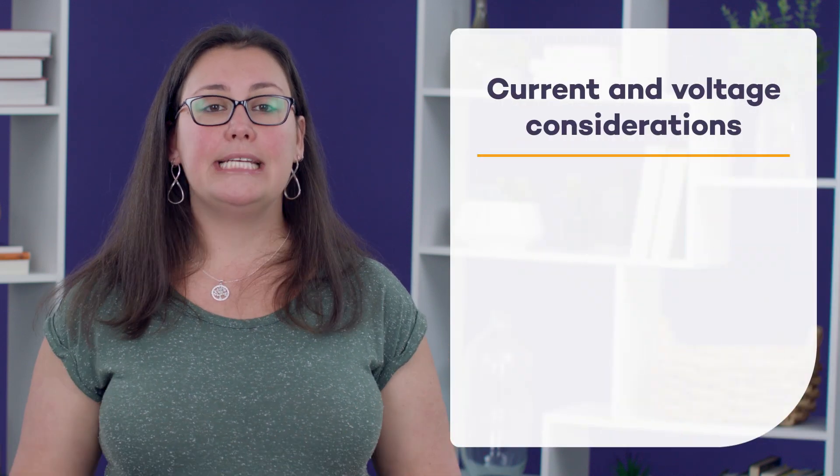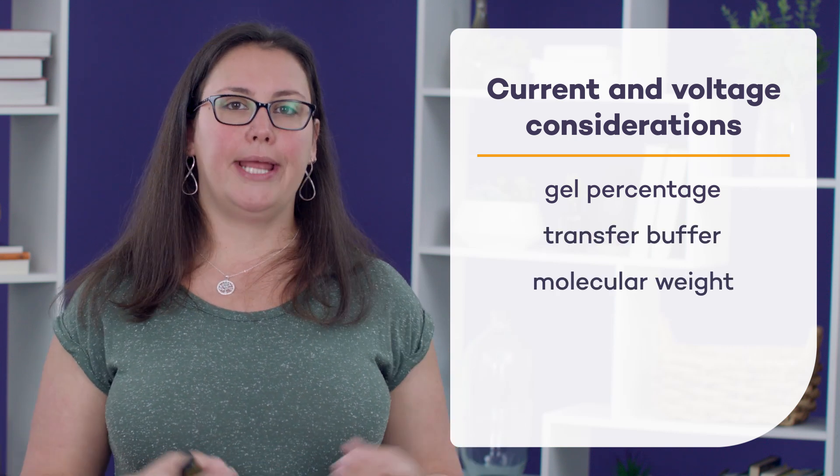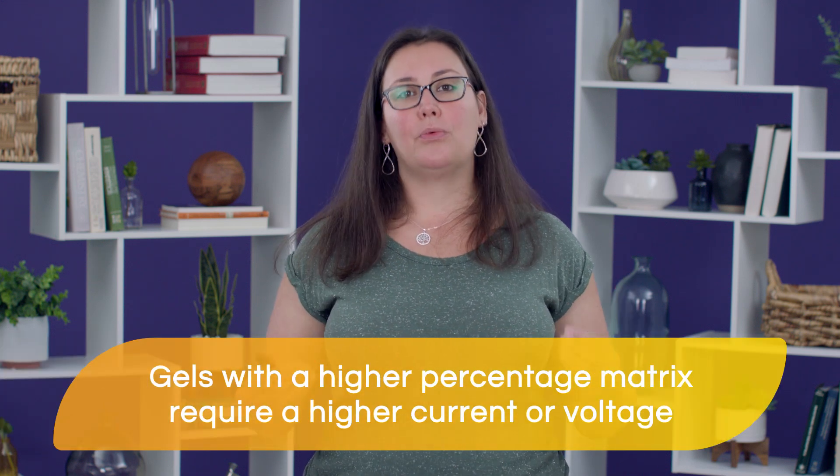Deciding what is going to be the perfect current or voltage for your transfer step is going to depend on your particular conditions, such as the gel percentage, the transfer buffer that you chose, and even the molecular weight of your proteins of interest. Don't forget to check the recommendations of your polyacrylamide gel as well as your transfer system. For example, the more modern transfer systems are typically faster, but they require a higher current or voltage. Similarly, when using a polyacrylamide gel with a higher percentage matrix, we're typically going to need to use a higher current or voltage. You'll also want to take into account the molecular weight of your targets of interest, and you may need to adjust the transfer accordingly.